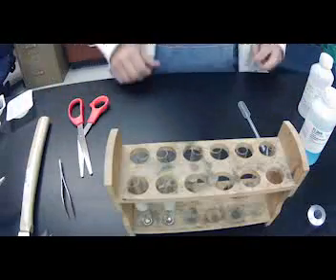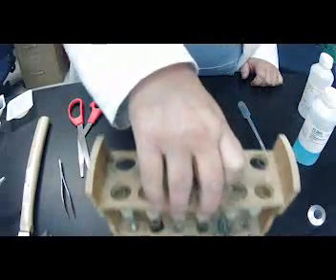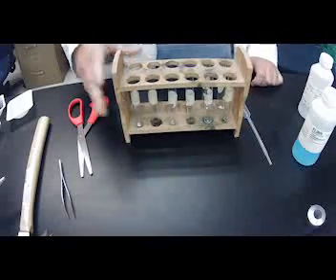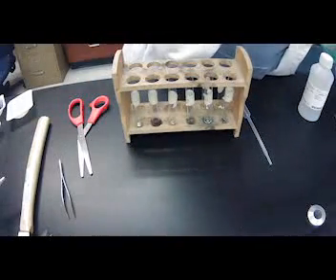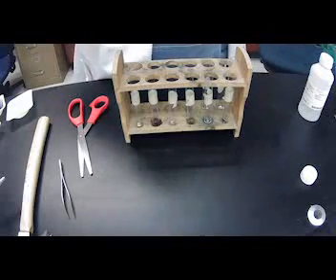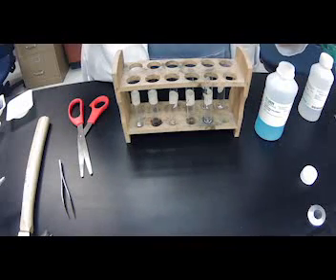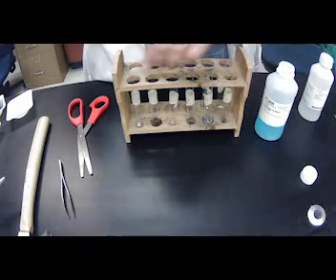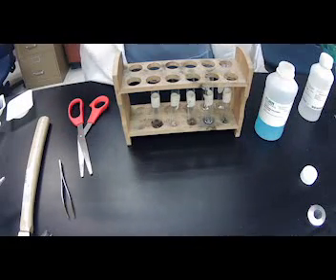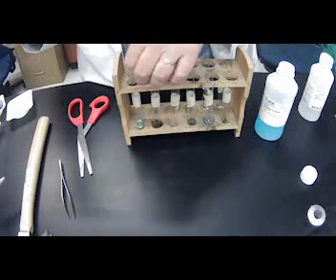Okay, welcome back. So we have all of our stuff back in here, and now I'm going to do the ones with copper chloride, okay? All right, here we go. Copper chloride has copper and chlorine with it, so it's an ionic. Does it have a reaction? The first one we're going to do is aluminum. And there's aluminum. Not really seeing anything happen.